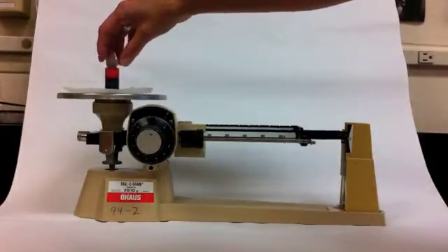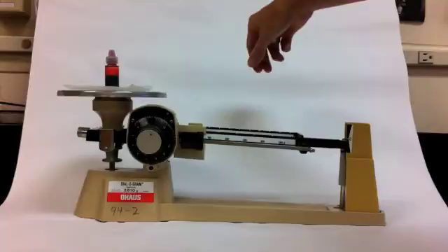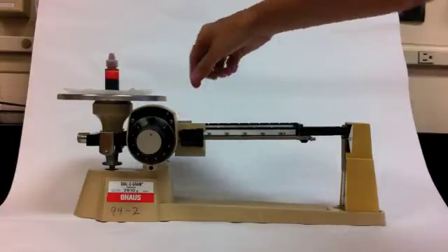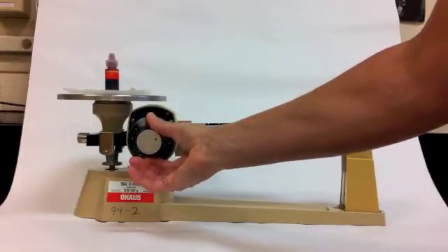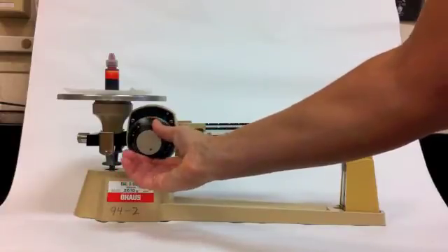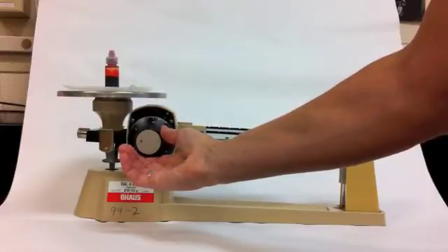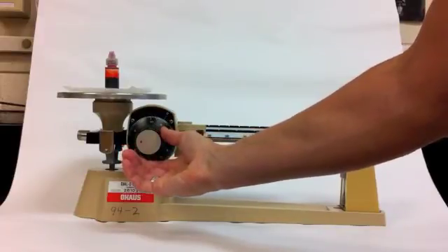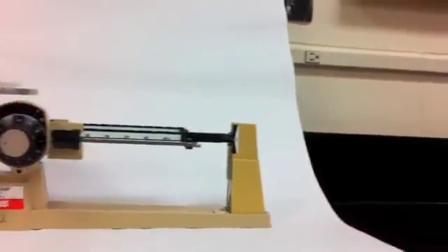Now you can put your chemical on the balance pan and start moving the riders. At ten grams, already ten grams is too heavy. So I move it back to zero. And again, I'm going to use the dial-o-gram. Now the arm starts to move. I want it to be exactly at zero. I'm going to dial back a little.